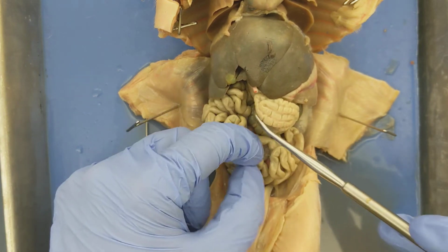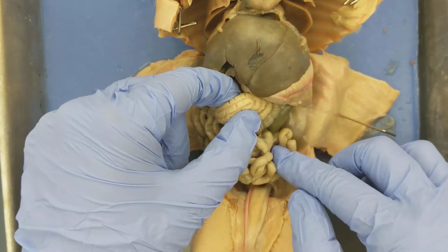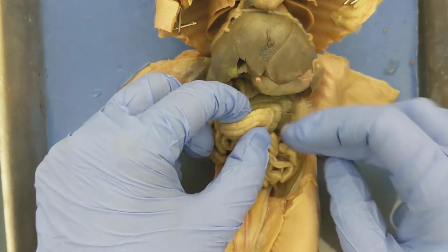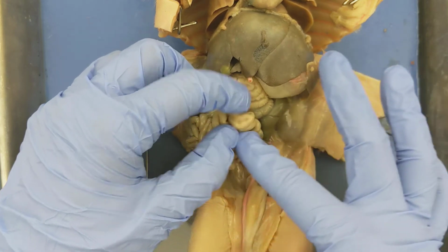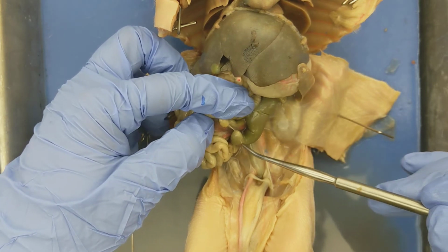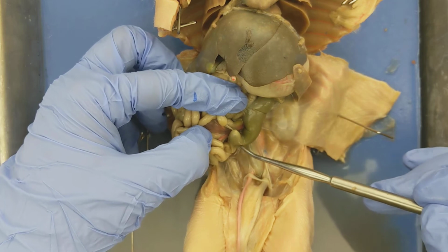If we take a closer look at the large intestines, you know that the large intestines and the small intestines attach together, right? The small intestines basically feed into the large intestine. And the small intestine feeds into the large intestines through a section of the large intestine called the cecum. As I rotate the intestines this way, if you take a look at this big, large, swollen section, it kind of looks like the head of an earthworm.